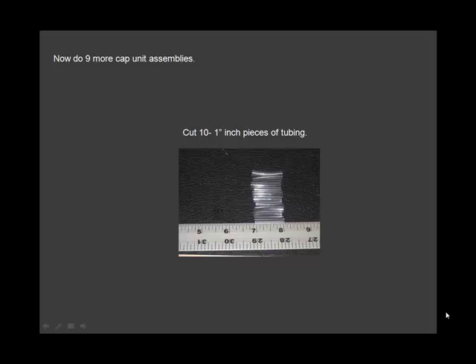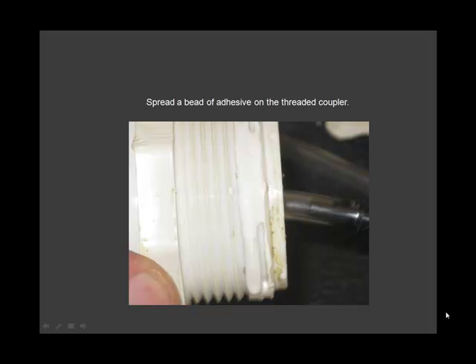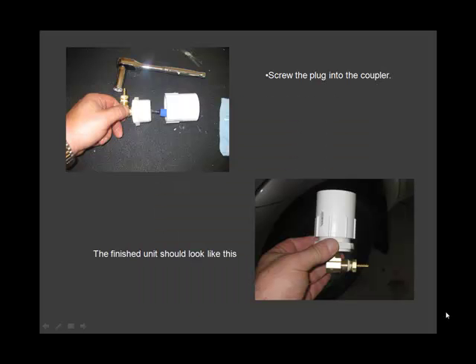Now do 9 more cap unit assemblies. It's a good idea to have a cup of water handy in your work area. Spread a bead of adhesive on the threaded coupler. Screw the plug into the coupler. The finished unit should now look like this.